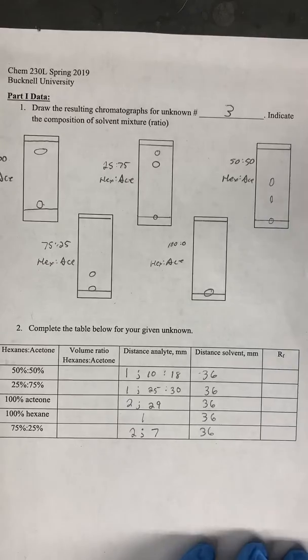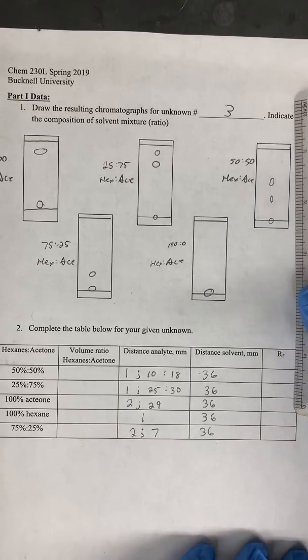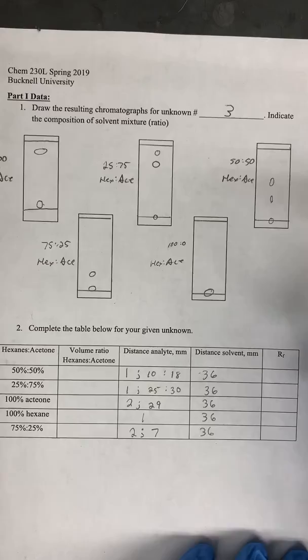And we were careful in doing this, and we measured a distance in millimeters for all five trials of 36 millimeters.